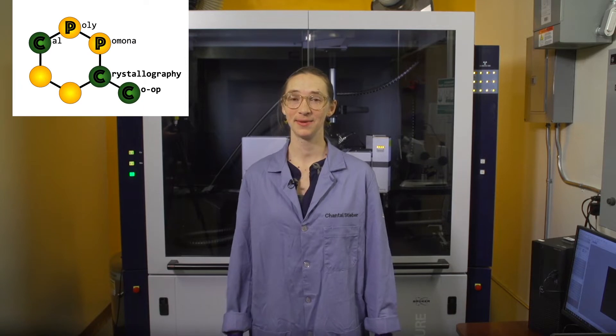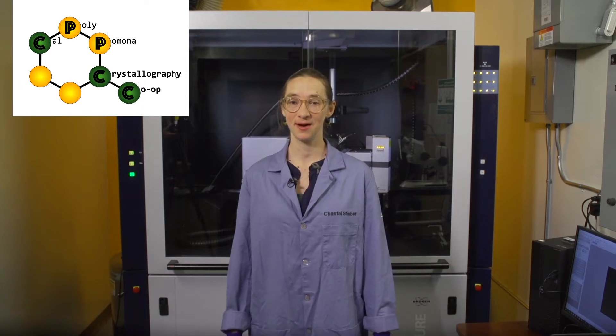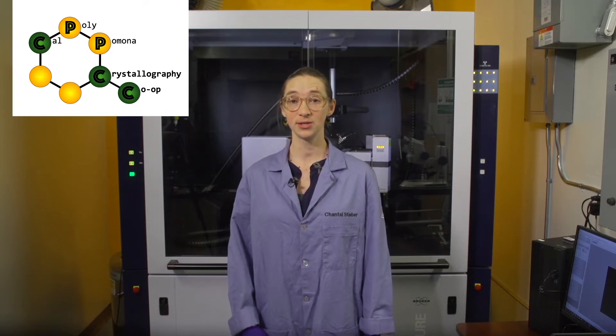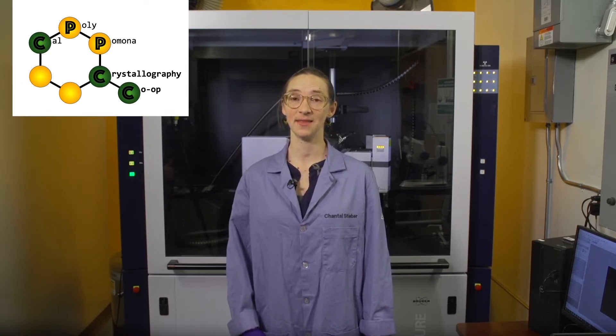Welcome to the Cal Poly Pomona crystallography co-op. Today, we will introduce how to use a single crystal x-ray diffractometer for determining the 3D atomic structure of a molecule, over the course of three videos. This first video will introduce radiation safety and the x-ray diffractometer.